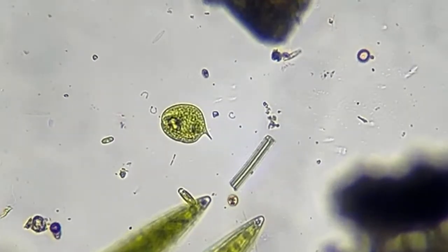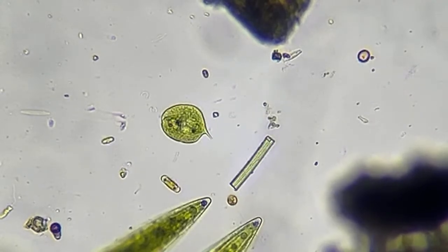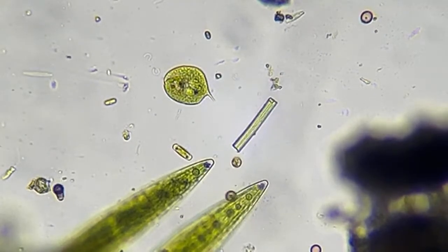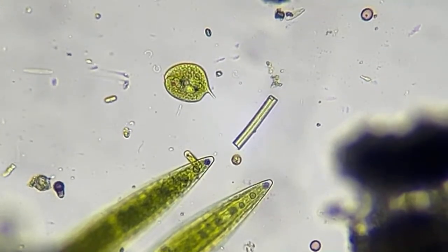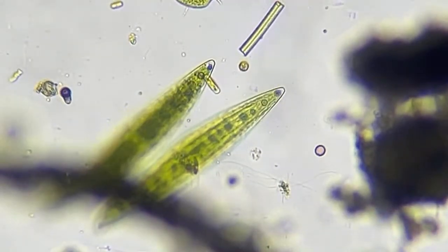And this right here is a Euglena that's kind of being still. Oh, and see that little thing moving to the bottom of the green round flying saucer? That is actually a diatom. And that produces oxygen. It actually has a glass silica shell.